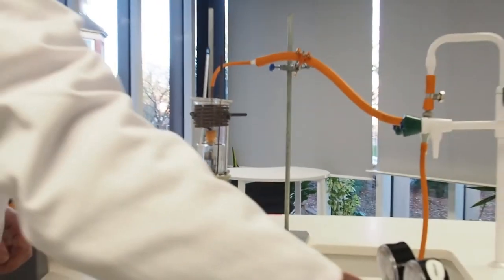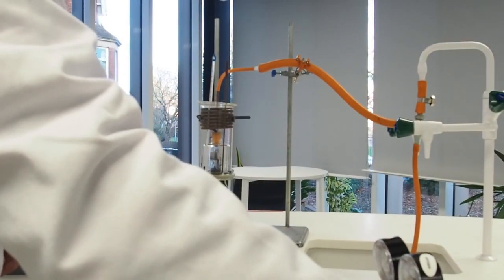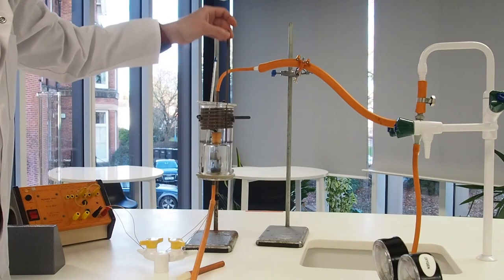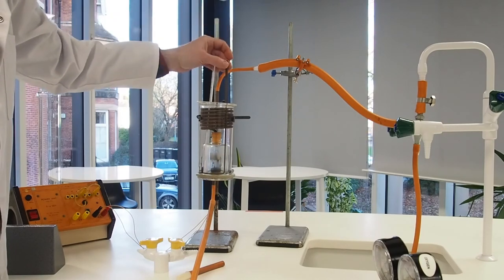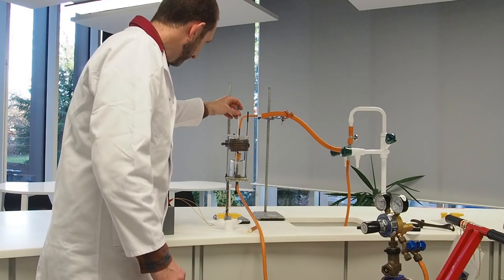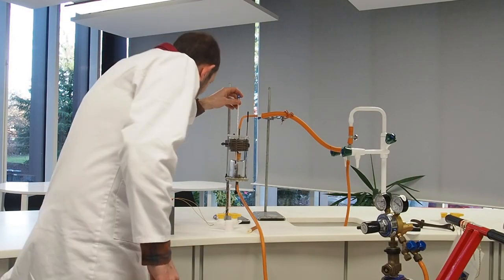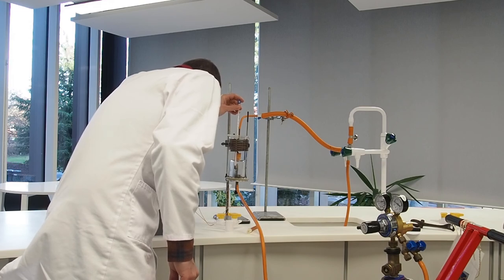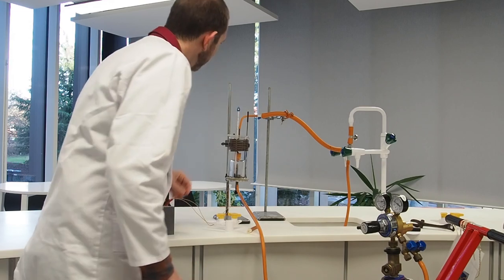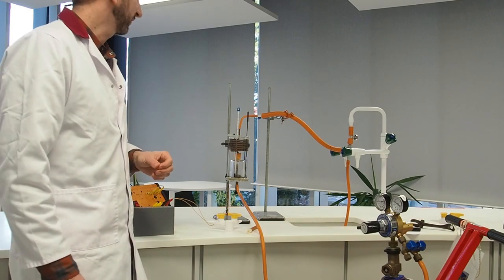Okay, so I'm just going to shut off the oxygen. Everything's gone out. There's no more fuel to burn. Let's give it a quick stir to share the temperature, and then we're just going to measure the final temperature, which is 23 and a bit. So we'll call it 23 degrees, so a change of 3 degrees.